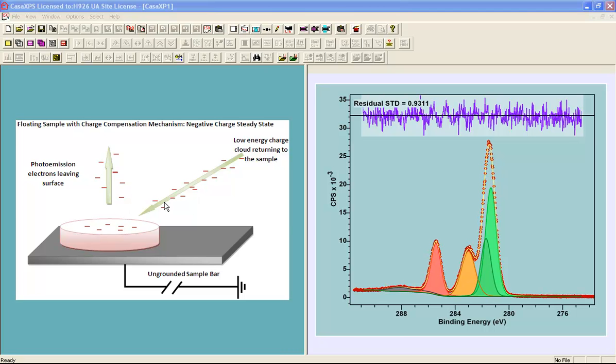To correct for this issue, electrons or other charged particles are returned to the surface in order to compensate for the fact that electrons are leaving the surface. In this case, this is an example of PET that has been measured using a given set of charge compensation settings. It's produced a set of peaks that appear at a higher kinetic energy than you might expect. This indicates that the surface has a uniform potential because we have nicely shaped peaks, but they are negative. So the electrons that are emitted are accelerated away from the sample.